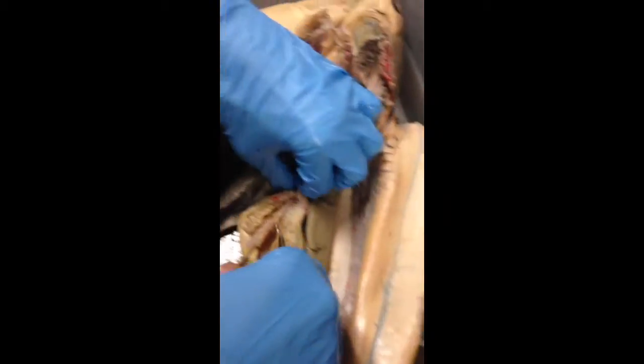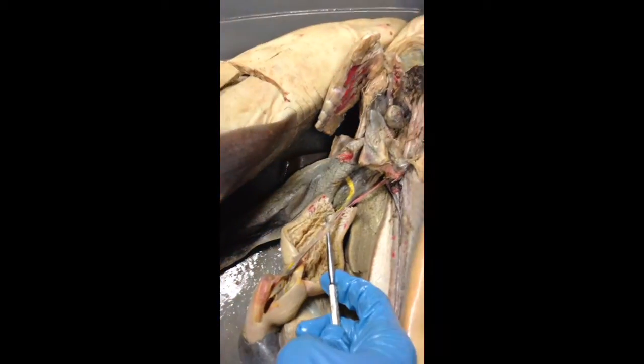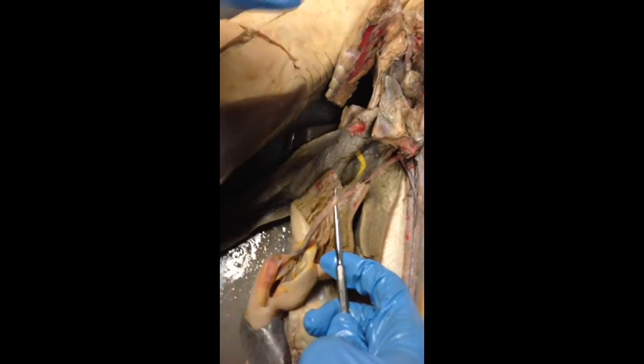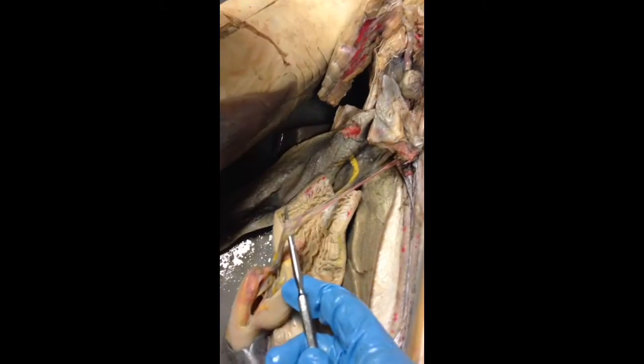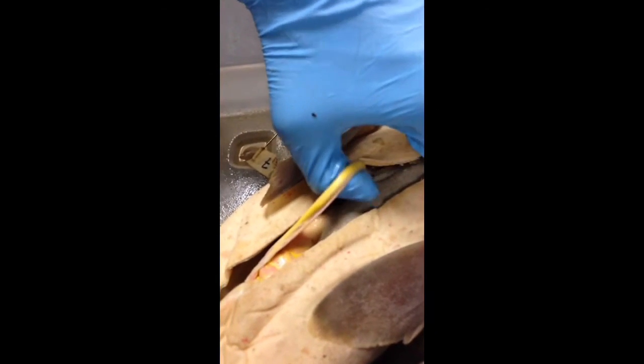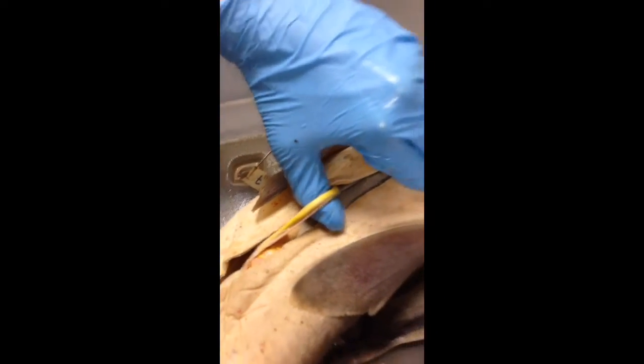Next is the hepatic portal vein. You can see it on both sharks here really quickly. It's pretty much the vein that runs through the entire length of the organism. It's yellow here, and it's very easy to differentiate on this female shark.